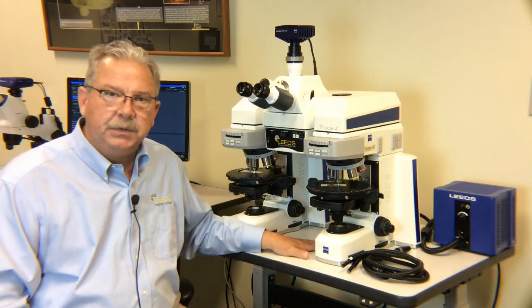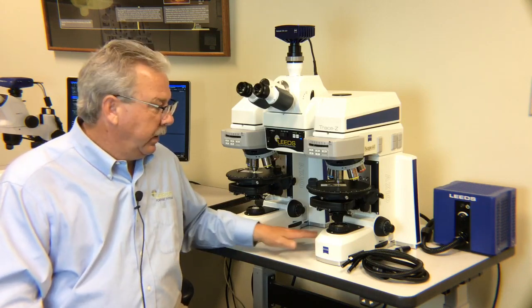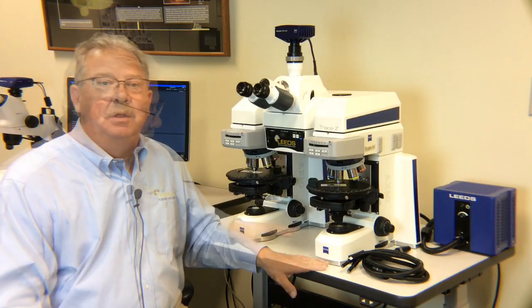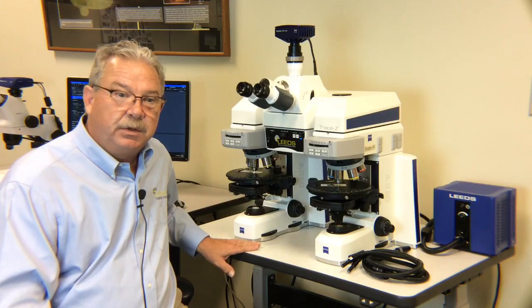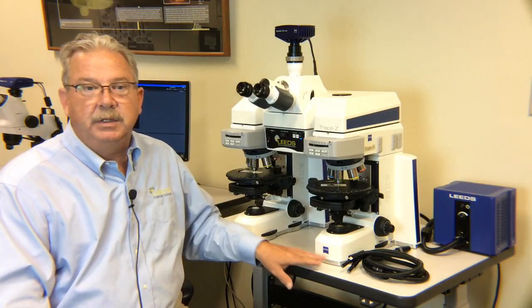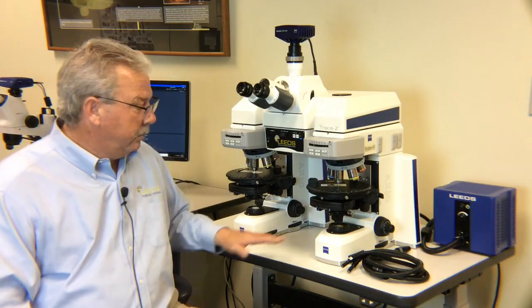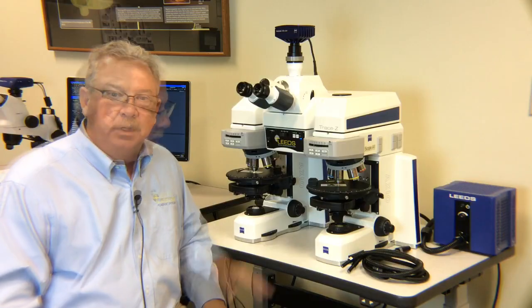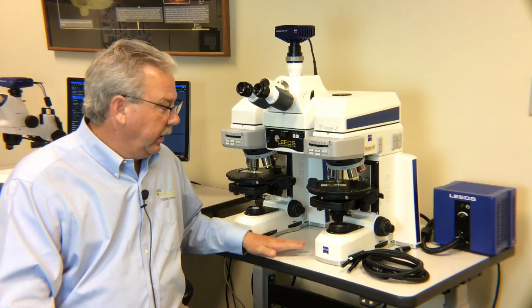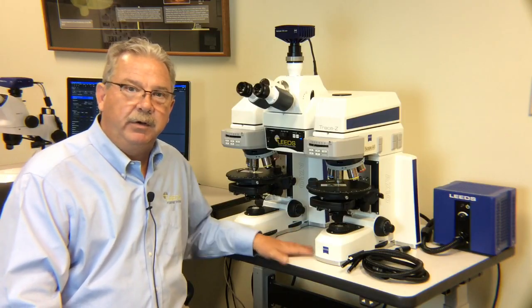So they're going to be using this as an investigative tool, and what they want to do is to be able to compare items found at the crime scene, maybe to a potential source, maybe to prove that the hair found on the victim looks very similar to the hair from a suspect. But they're going to be comparing those items. The beauty of this, if you're already a microscope salesperson, is I think you're going to get comfortable with this microscope very quickly and very easily.